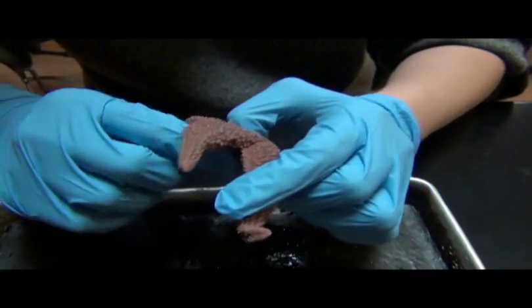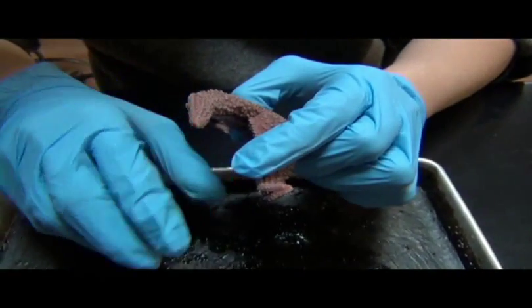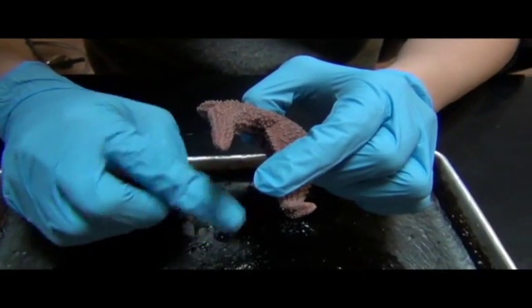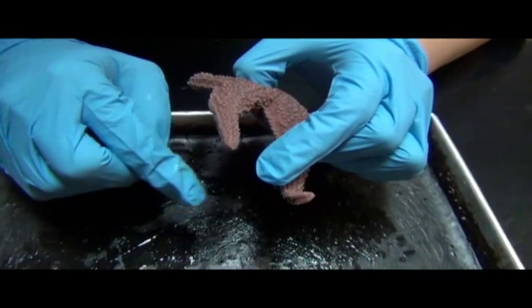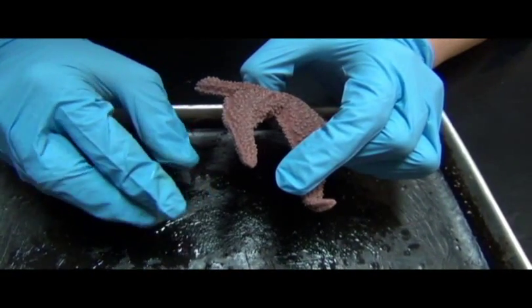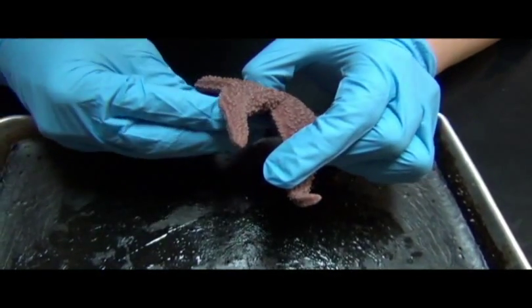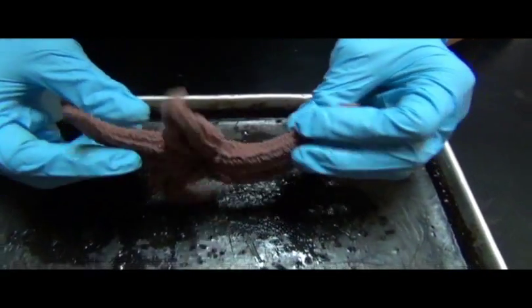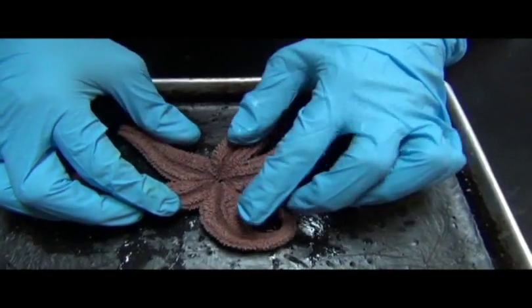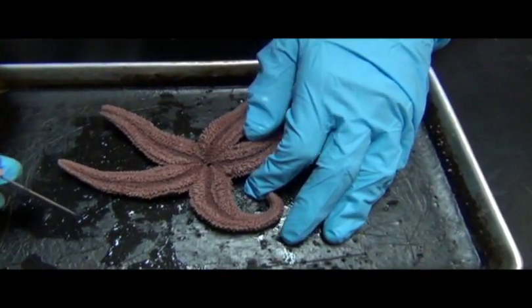It's still attached to the animal, but it will sort of crawl out, go into the body of the clam, and digest it. Digestion occurs outside the body in the case when it's digesting a clam, and then once everything is done, the stomach gets absorbed back in with the nutrients that have been produced from the digestive process. I hinted at structures called suction cup feet.